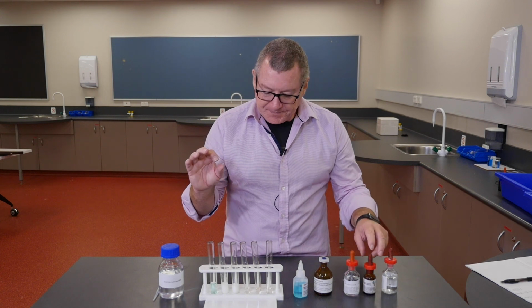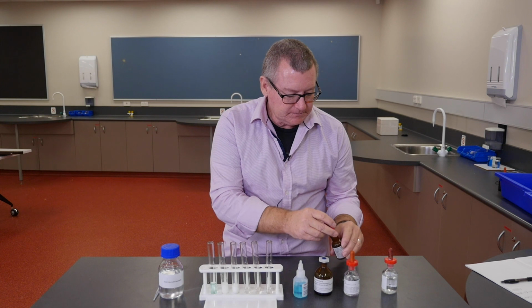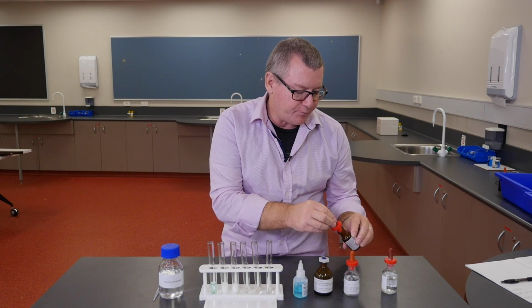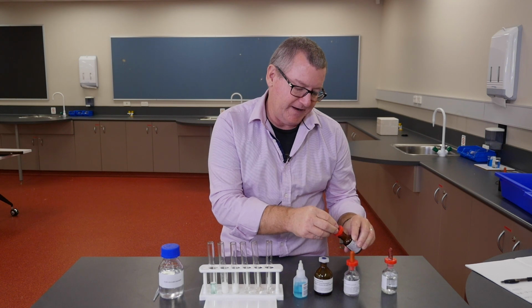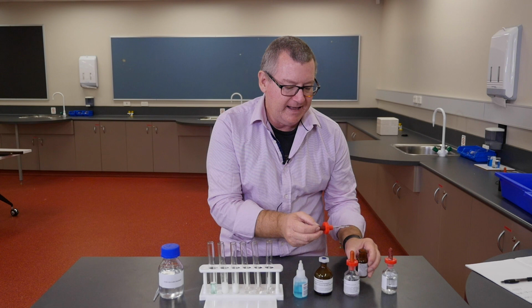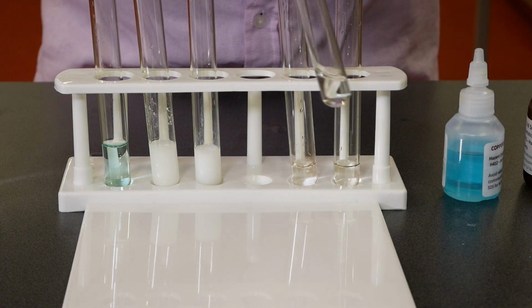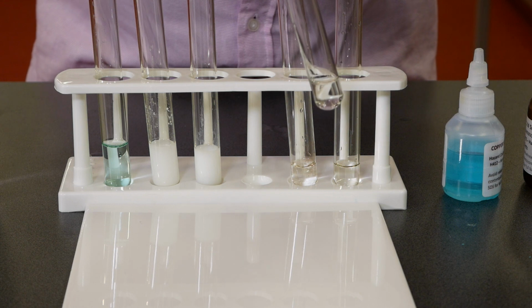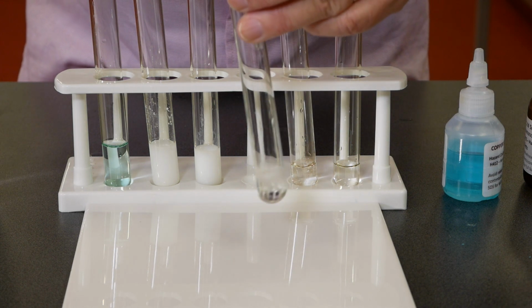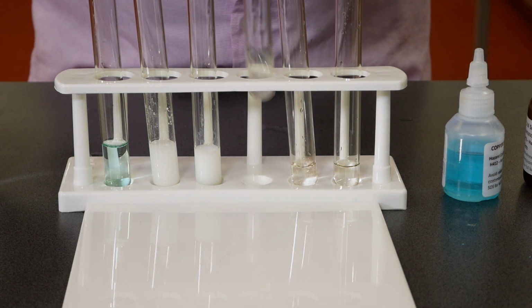So we'll do lead nitrate. Again, a nitrate is probably soluble, the calcium nitrate. In fact, we already know calcium nitrate's soluble because we just did something with a nitrate before and didn't get a precipitate. But the lead chloride may not be, and indeed isn't. So we get a precipitate there. I probably need just a slightly bigger sample.